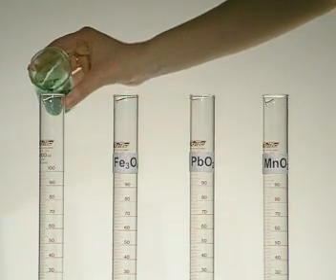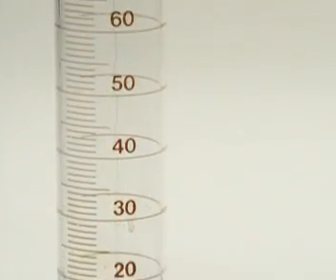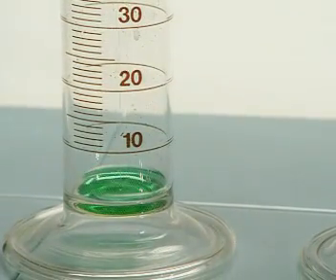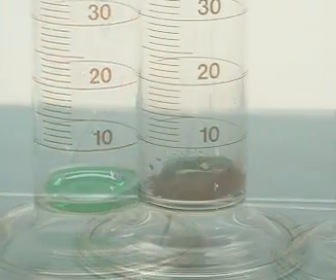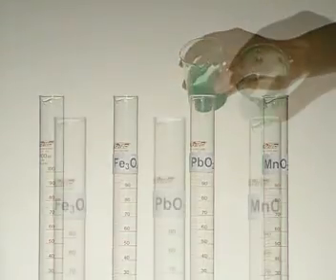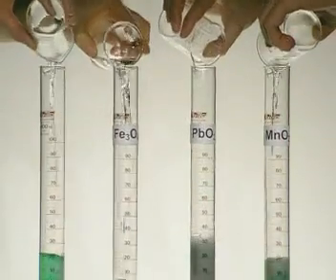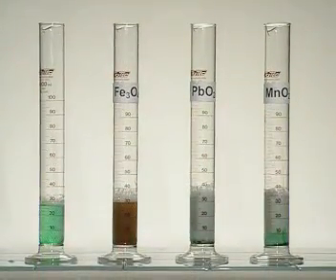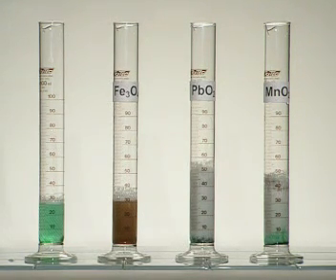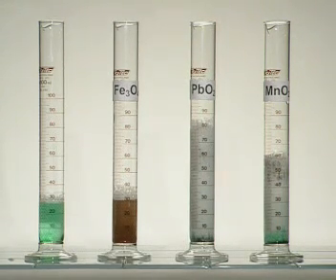A small amount of washing up liquid is added to make the production of oxygen more visible. The tube on the left is the control — it contains no catalyst. Finally, in goes the hydrogen peroxide. As oxygen is evolved, the washing up liquid forms a foam which rises up each cylinder. The rate at which the foam is produced is a measure of how effective the catalyst is.